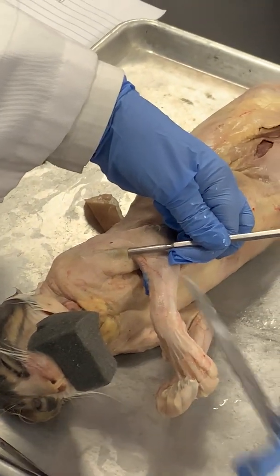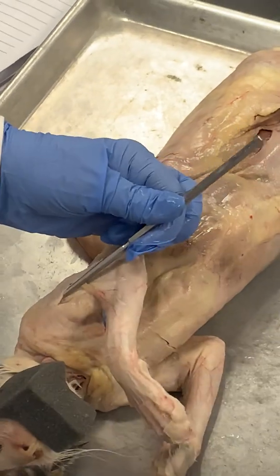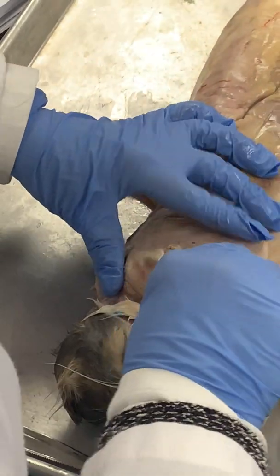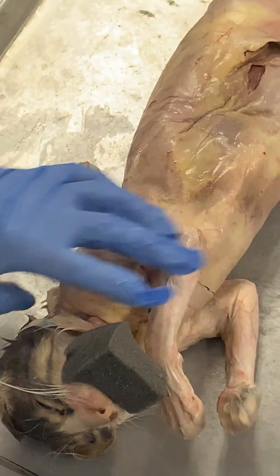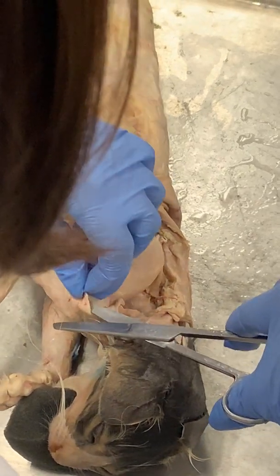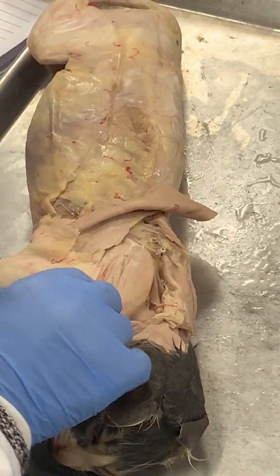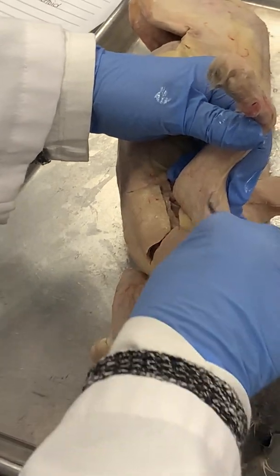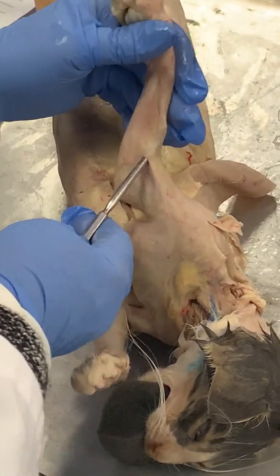See how I can see blue — so then I know it's safe to cut. Or see the probe silver? Looks kind of blue. The deltoid is a big muscle and it's difficult at best to get in there. I'm just going to do the other side. Got to be really careful here because the brachioradialis is right underneath the skin.